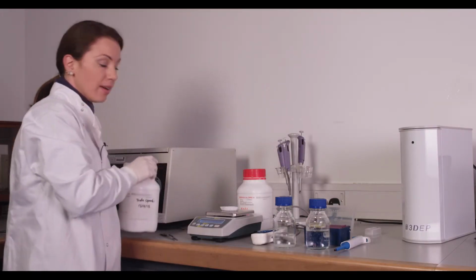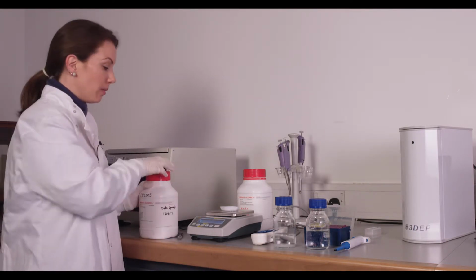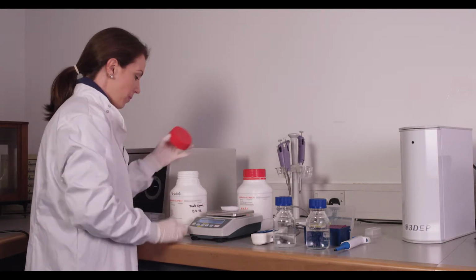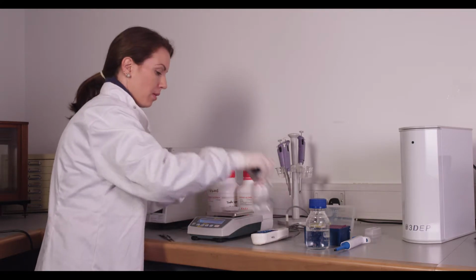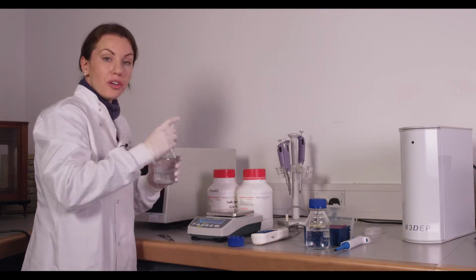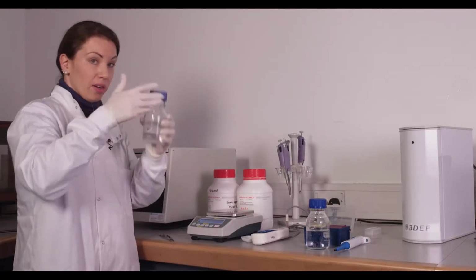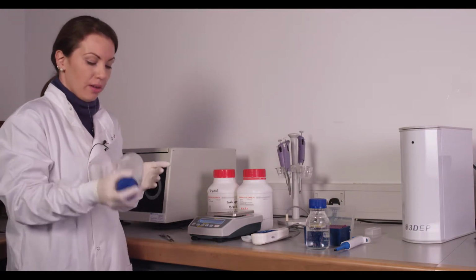The glucose you add as 0.3 grams, so that's 0.3% of a 100 ml solution. You'll mix all of this into the DI water. You can use a stirrer, you can manually stir it, or if you've got a nice bottle, you can just shake it. And this should all dilute fairly quickly.